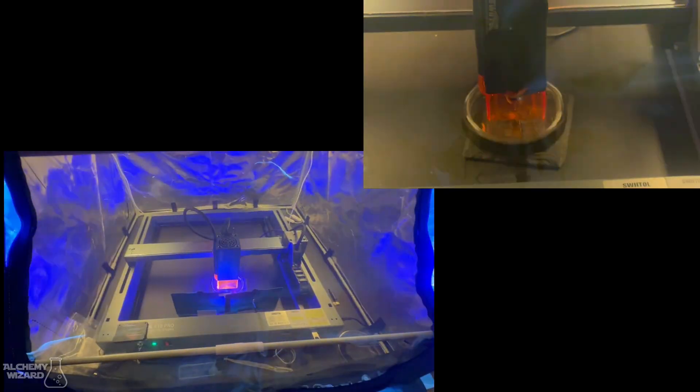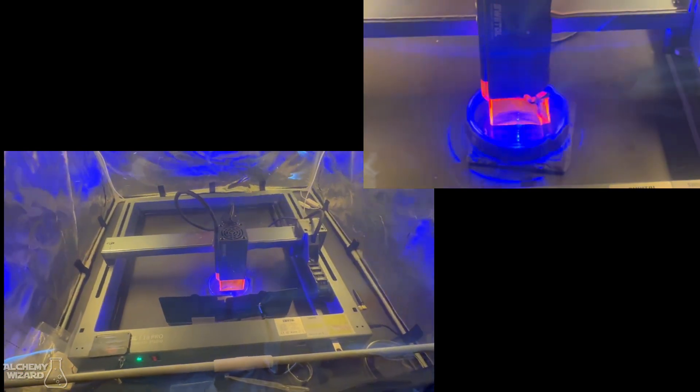In the last video I talked about the blinding blue light that comes from the laser engraver when we're making nanoparticles. Now it's a big problem for our eyes. Well, I've come up with a solution for it.